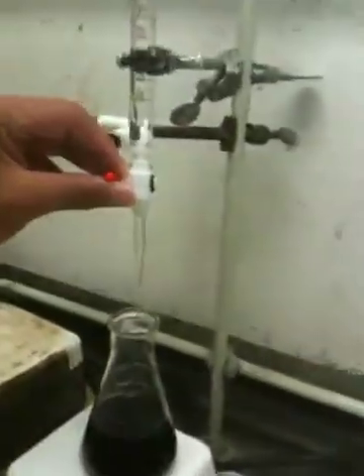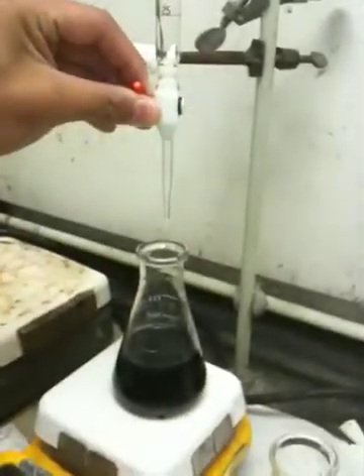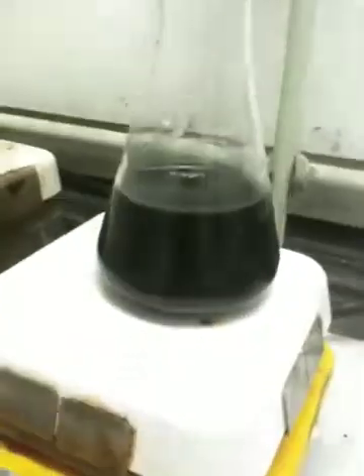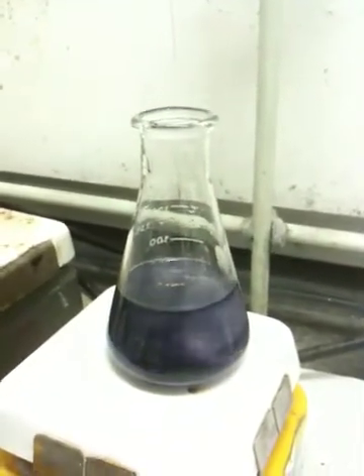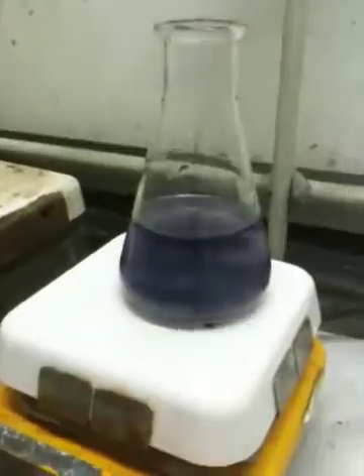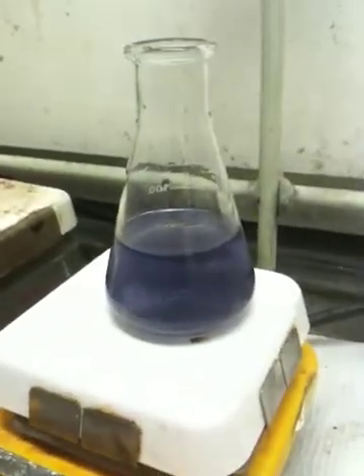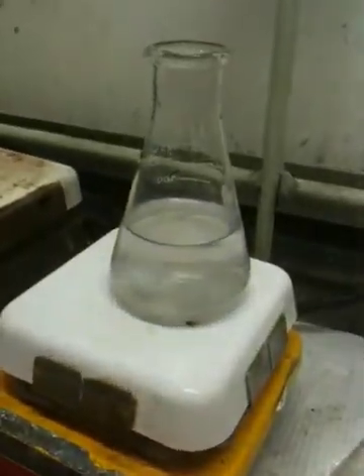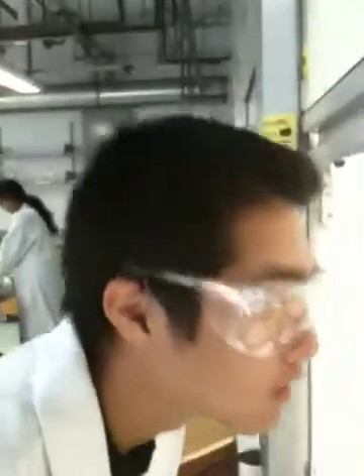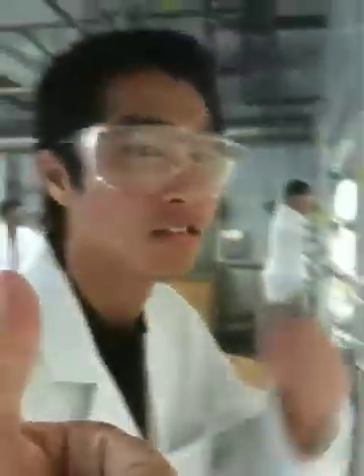So he's adding 10 drops of this wholesome goodness, placing it back, and titrating. It usually takes one to three drops and you'll see the magic — it's going to magically change into a super cool color called clear. Not quite — it resisted the change. We have resistance to change here. Drop it. There it is! Finish it off. Complete. Very good titration this time. Props to you, Daisuke.